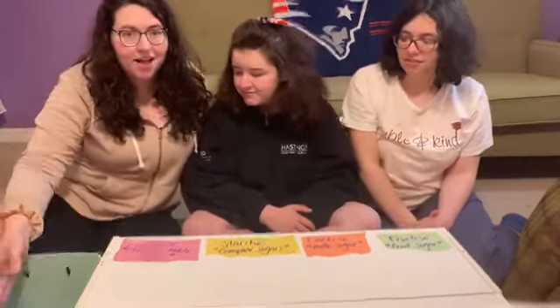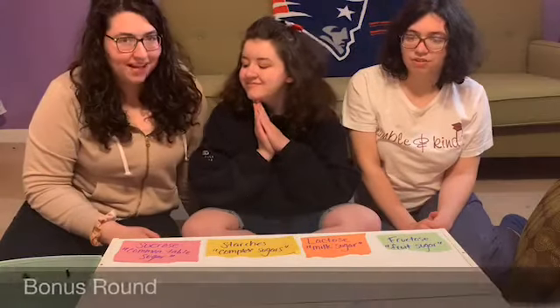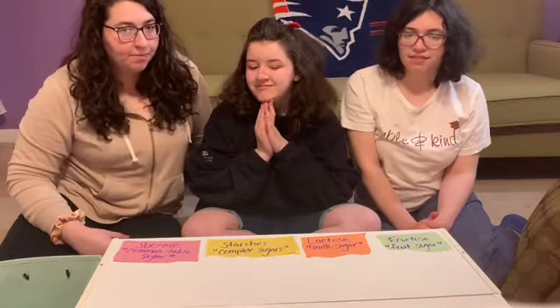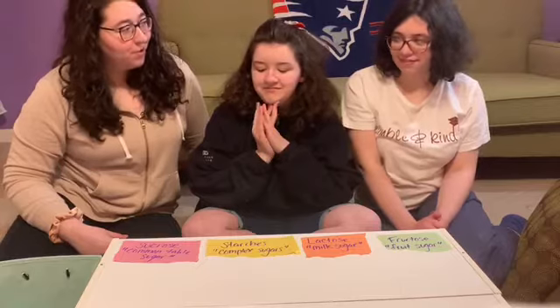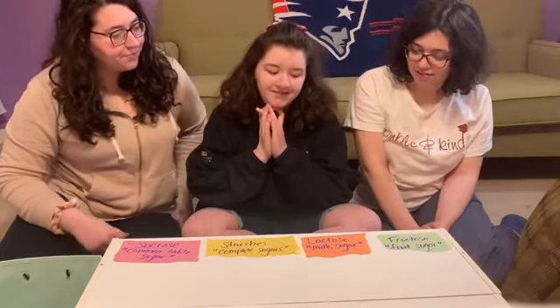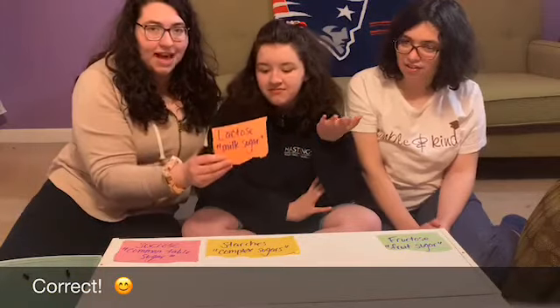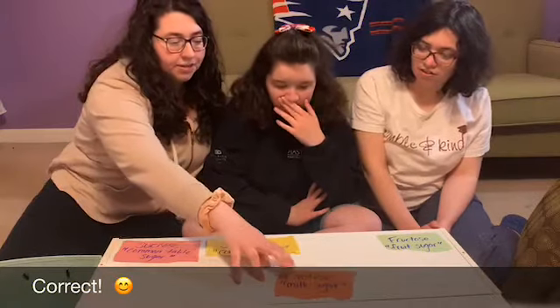Well, since you all got the answers right, you get to go together to the bonus round. Now, bonus round question. Based on all the objects you've played with in this game, what do you think contained glucose? You can collaborate with each other on this question. Maybe that one. All right, so Leanne maybe thinks lactose. Some of the lactose products, such as ice cream and milk, might have contained glucose. Good guess.